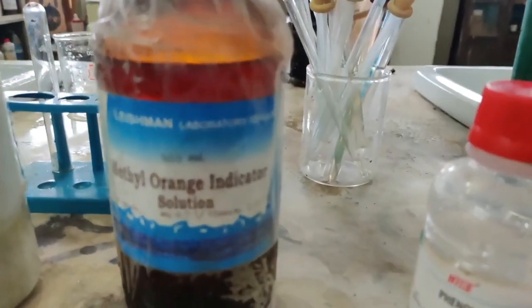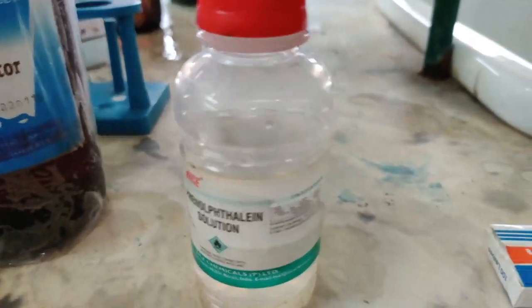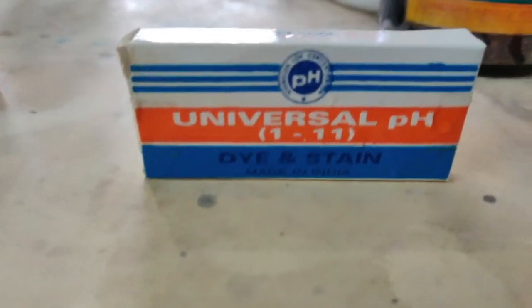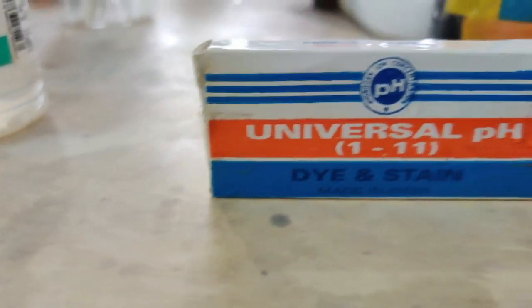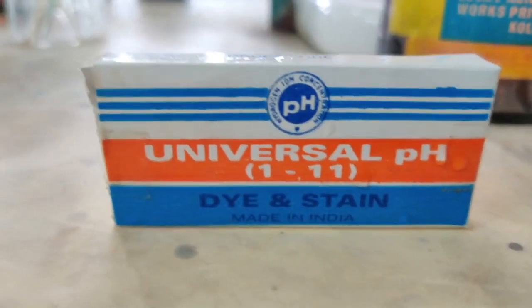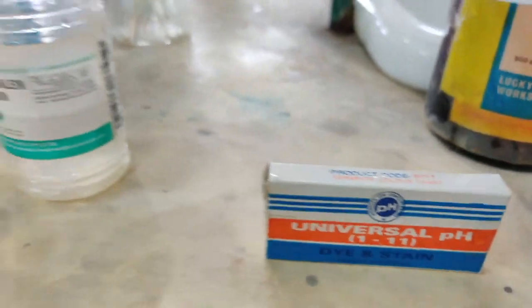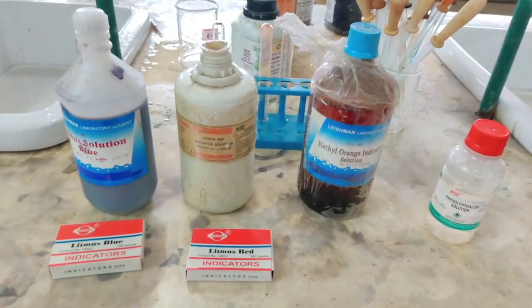To say how acidic or how basic, we also discussed the universal indicator. Later on I'll show you its use also. Here it is. This is the paper. We have only the paper, we don't have the solution. This is the universal pH. In fact, universal pH is from 0 to 14, but the paper that we have in our lab can only measure from 1 to 11. Usually in laboratories you'll have from 0 to 14. So you can see this is the pH paper I was talking about. I'll also show you how it looks from the inside. Then let us see now the test of acid or base by using these three common indicators.